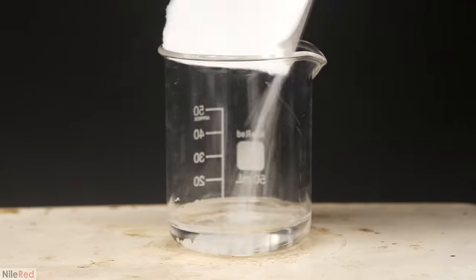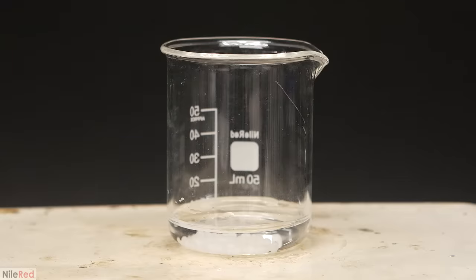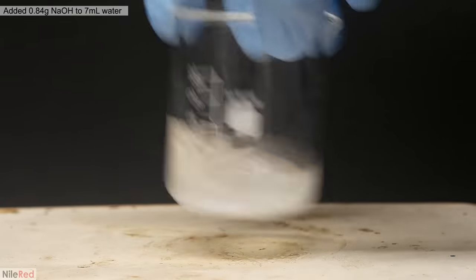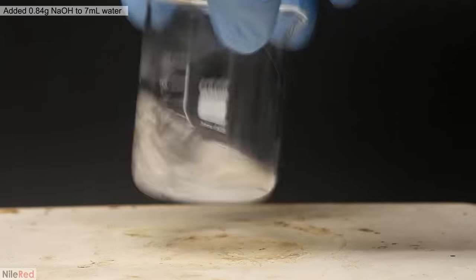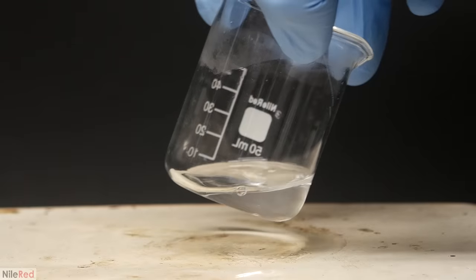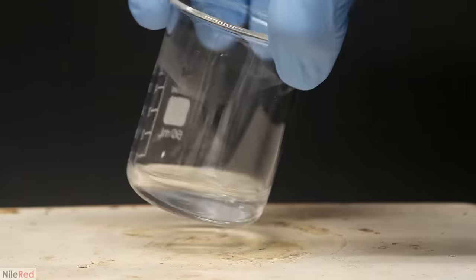Anyway, to start things off, I needed to make the catalyst for the reaction, which involved making two solutions. For the first one, I added 0.84 grams of sodium hydroxide to 7 mils of water. It all dissolved with just a bit of mixing, and then I temporarily placed it on the side.